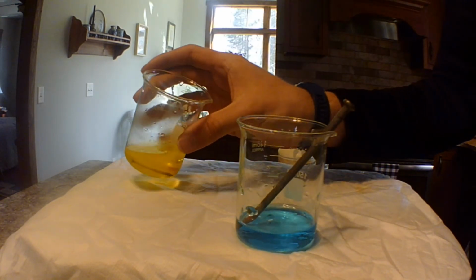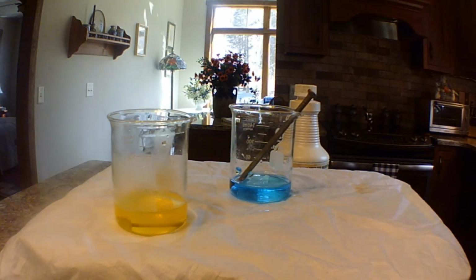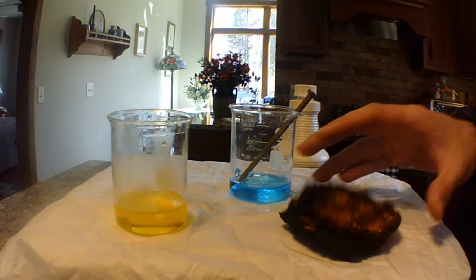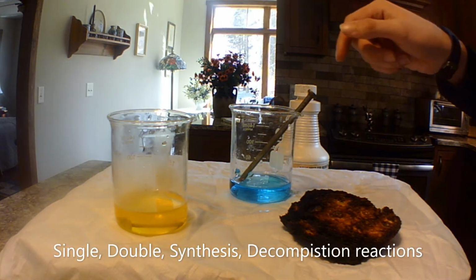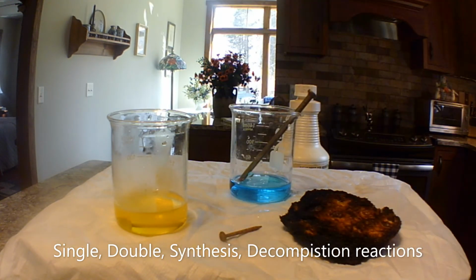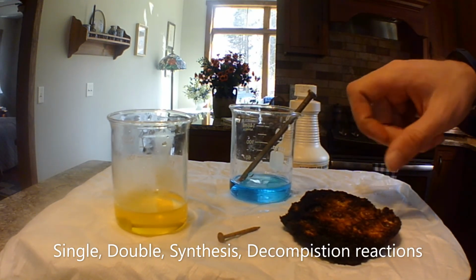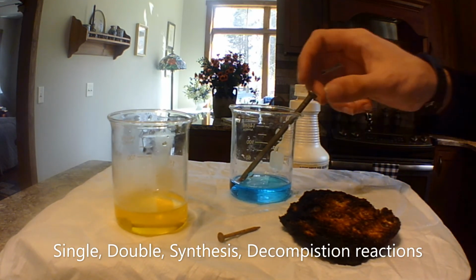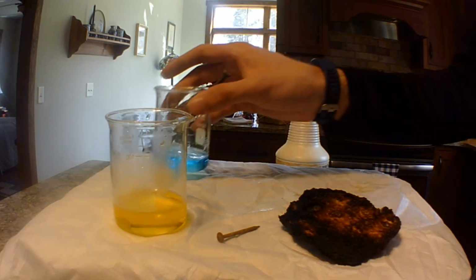And these are examples of the 4 different types of reactions. I'm going to bring this over here so you can see it. This is single and double, and I'll put this up here. This is an example of composition, and this is a decomposition. And this is also single replacement, but this isn't one you can do at home, not easily.